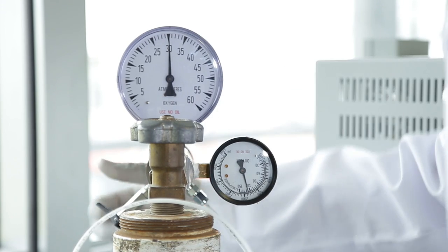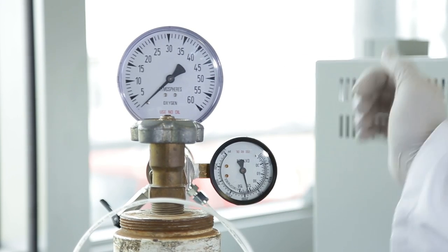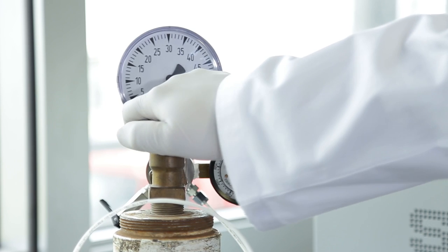Close the control valve. Release the residual pressure in the filling hose by pushing downward on the lever attached to the relief valve.